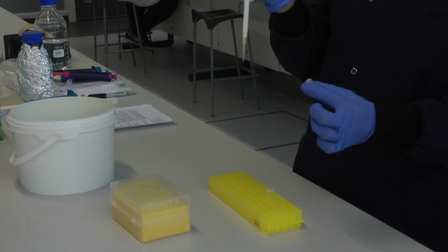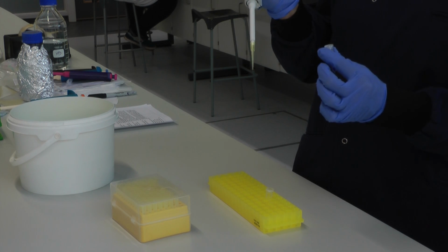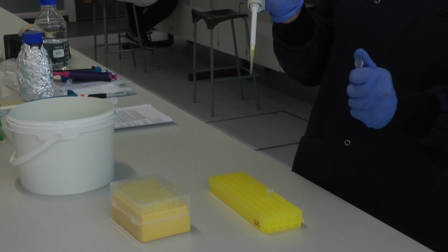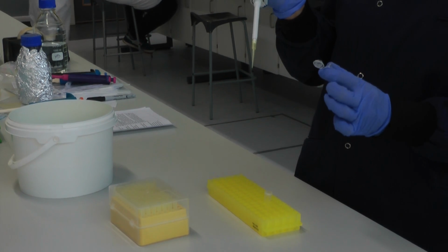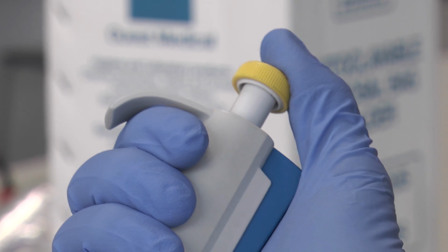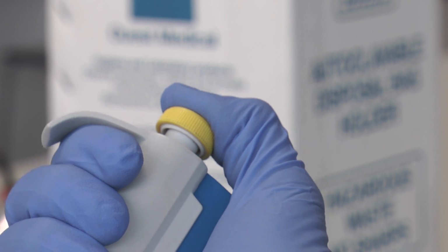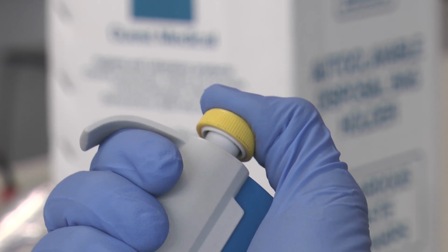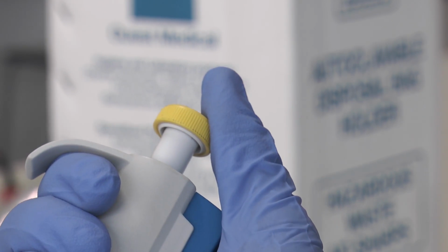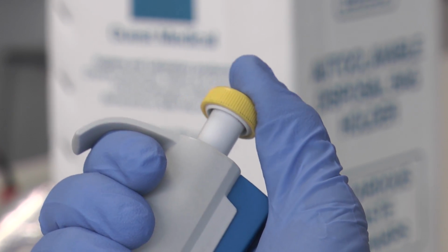Now I'm going to dispense 100 microlitres of solution from this tube. In order to suck up 100 microlitres, what I need to do is, first of all, take the lid off the tube and press just very gently with your thumb on the plunger. You'll notice if you press gently, it comes to a natural stop. You will notice that if you press harder, you can go past that. You can push it down even further, but don't for now. So to suck up, press just very gently as far as the first stop.